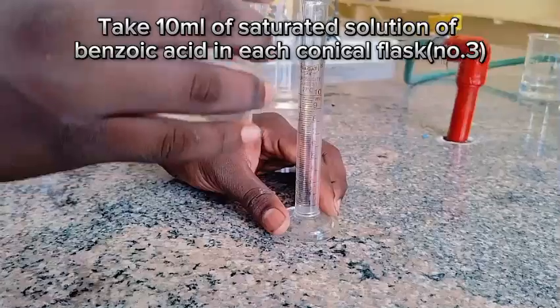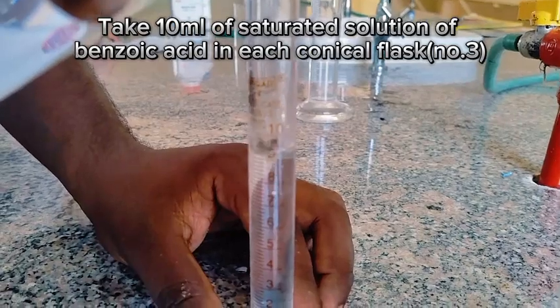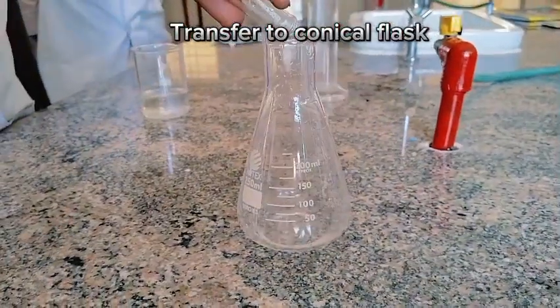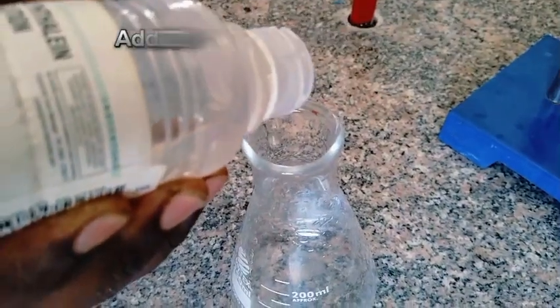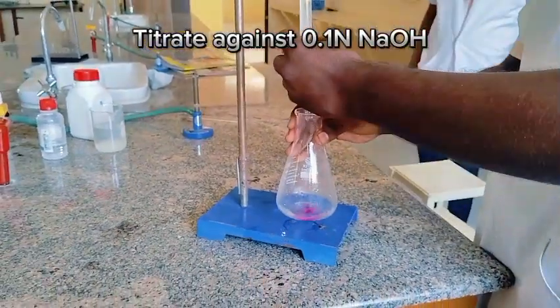Take 10 ml of saturated solution of benzoic acid in each conical flask. Transfer to conical flask. Add 2 drops of phenolphthalein. Titrate against 0.1 N sodium hydroxide.